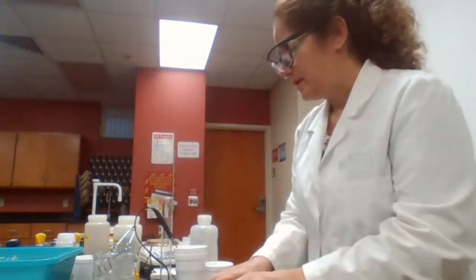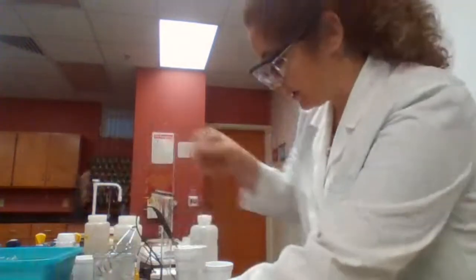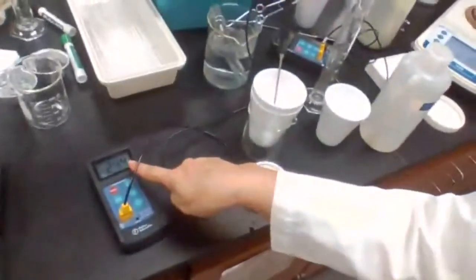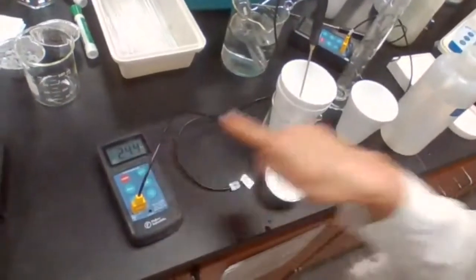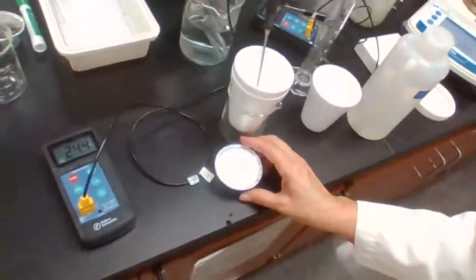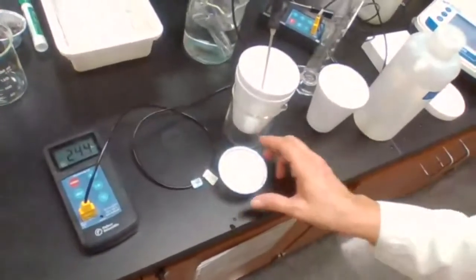Okay, we have the temperature of the water showing in here. Take a screenshot in case you missed the last two. Now you have these numbers. That's the value for the initial temperature of the water before adding ammonium nitrate. The mass for ammonium nitrate is 8 grams.